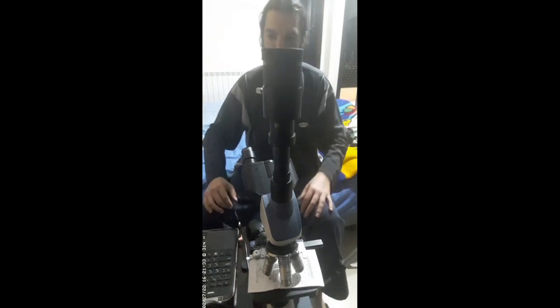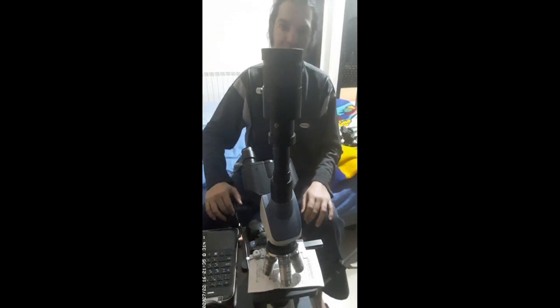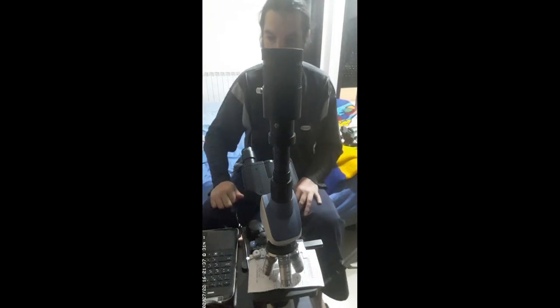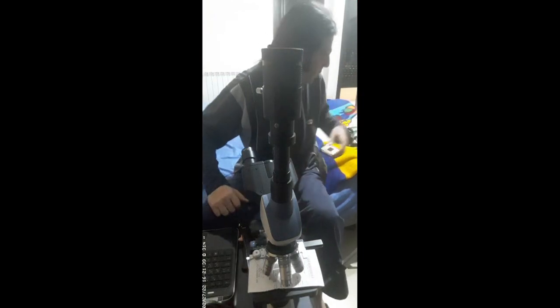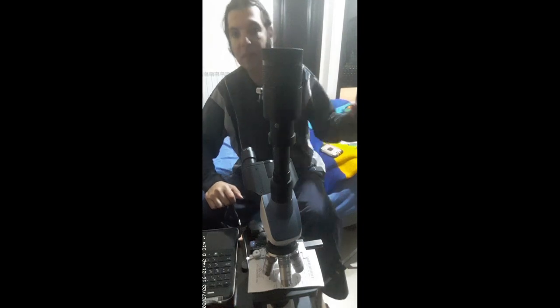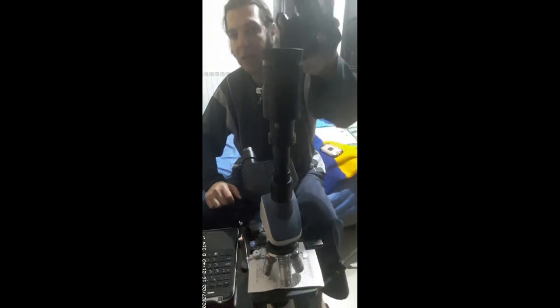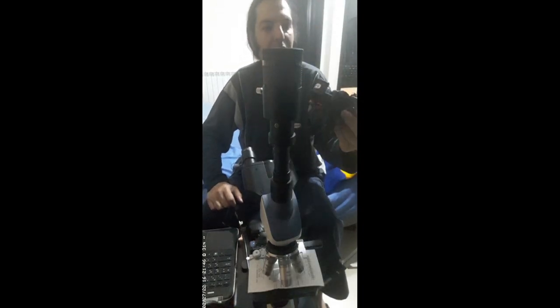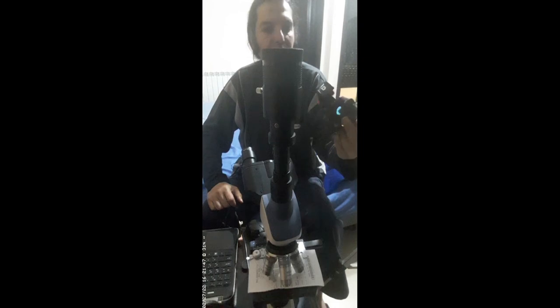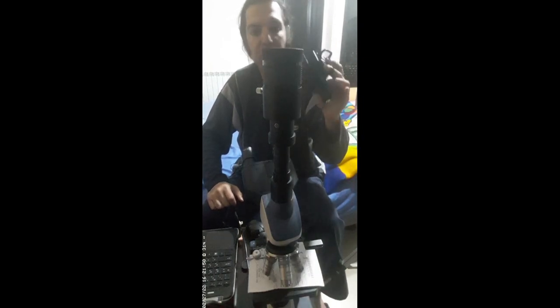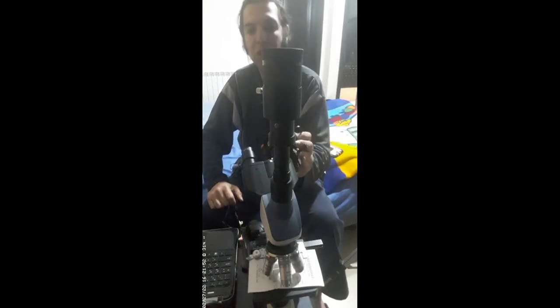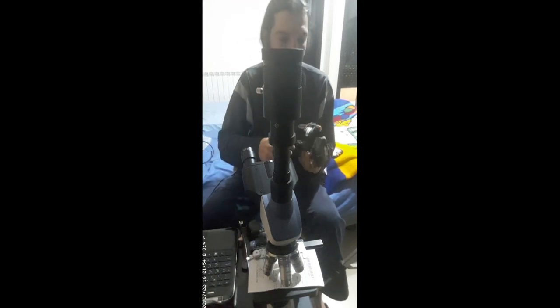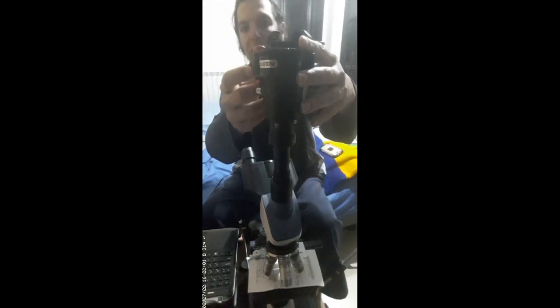The telescope has a 2-inch eyepiece of course, and you can raise your eyes higher to get a wider field of view. With this telescope mount, it can take the 2-inch eyepieces and the 1.25-inch eyepieces, and it can also be used over the microscopes. This is a sensor XYZ mount. This way you can just install it like this. It has this screw from here. I can show it from here, it has this screw.